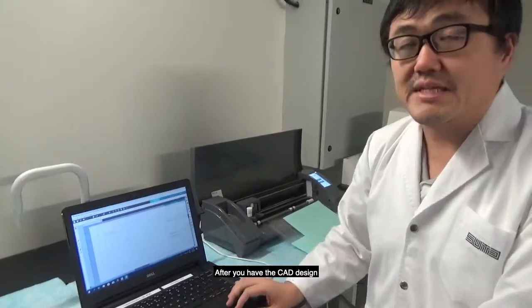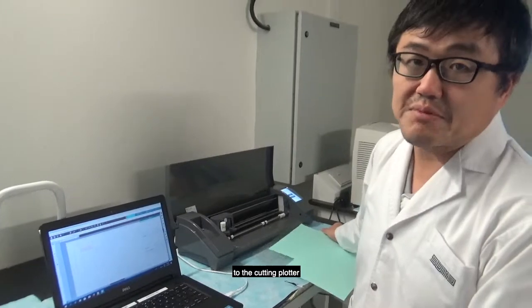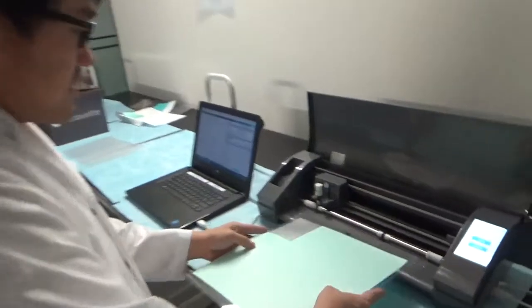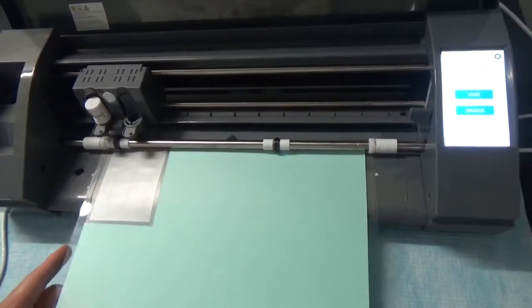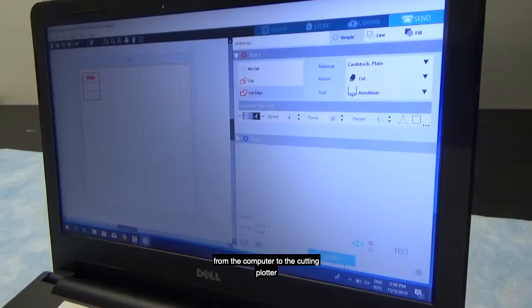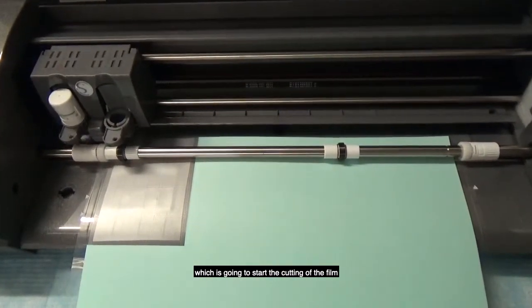Okay, after you have this CAD design, which we have already created for you, let's set the film to the cutting plotter. We are setting this cutting mat to the cutting plotter. We can place it here, and then push load. And after that, you can send this pattern from the computer to the cutting plotter. Just press send, which is going to start the cutting of the film.